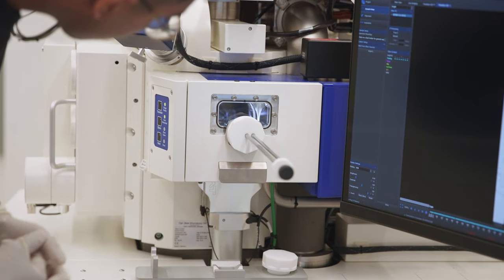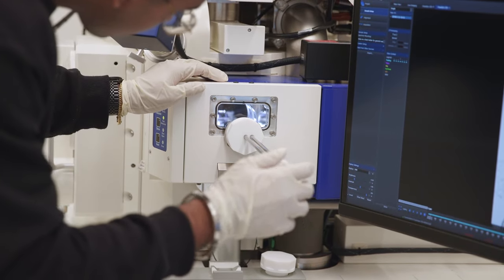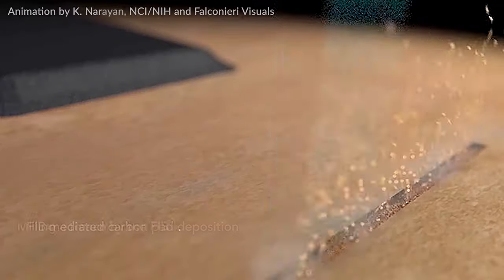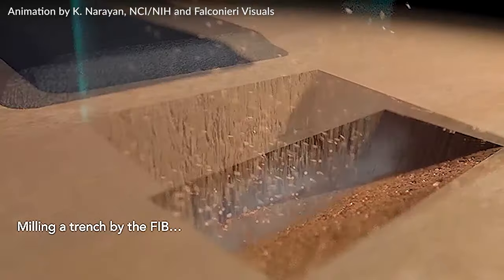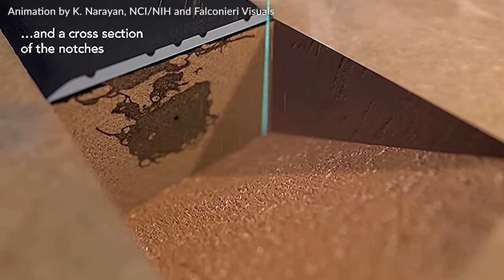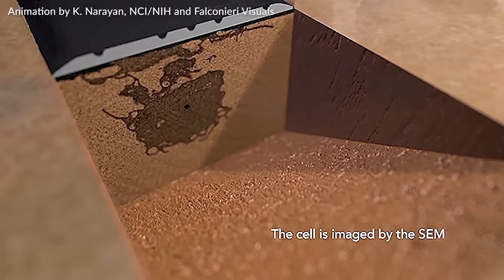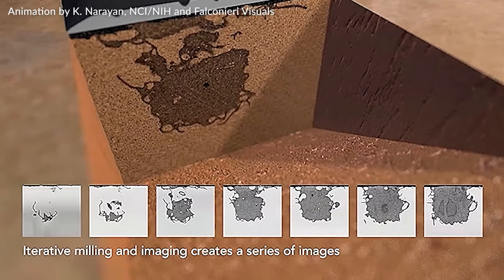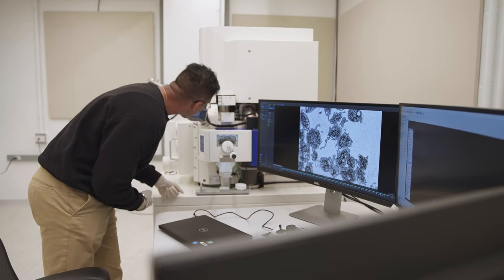Right now I am looking at platelet morphology for COVID-19 patients, which requires me to work on a focused ion beam scanning electron microscope — different because I use ions to slice off a sample and use an SEM to image, while traditional SEMs use an actual knife. The beauty of this device is I get higher resolution images compared to other SEM modalities; with the FIB-SEM I can get a Z resolution of close to 3 to 5 nanometers.